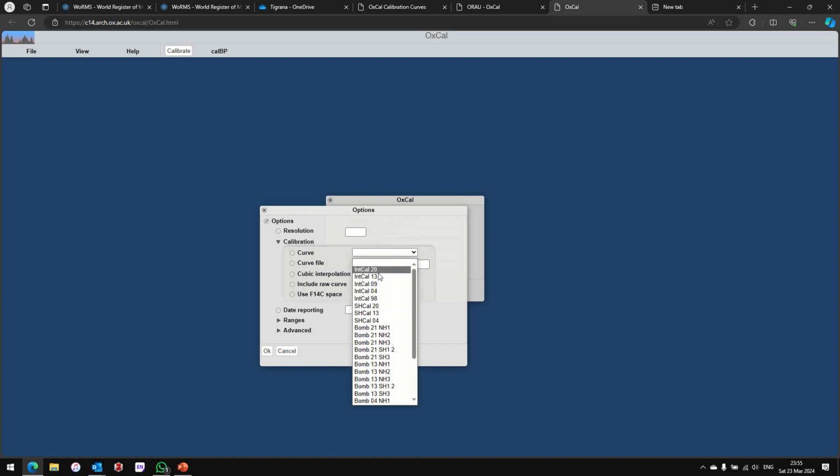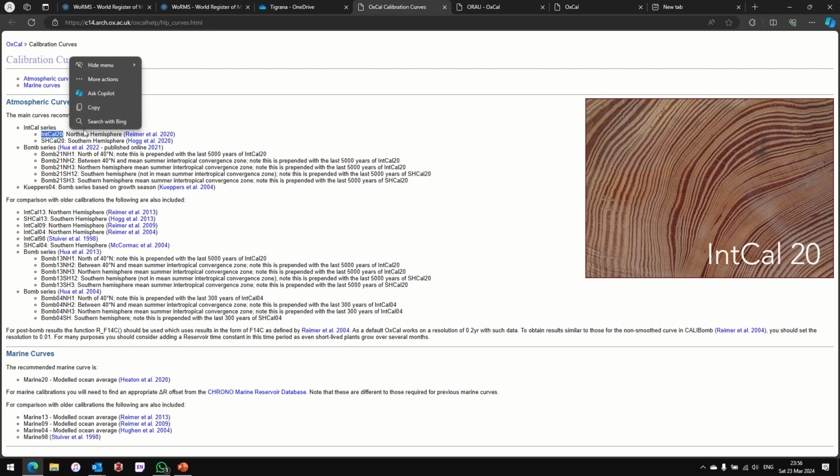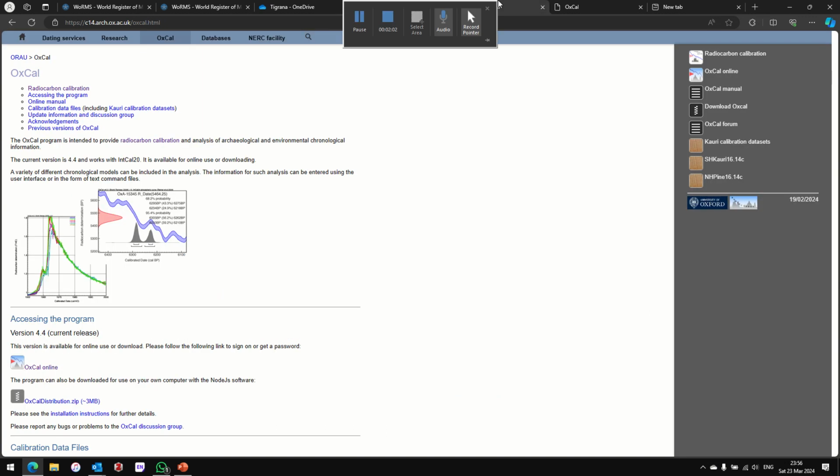mine are terrestrial gastropod samples, and these bomb curves don't seem appropriate for that, because these bomb curves are apparently the hydrogen bomb. I really don't know what these exactly are. The most appropriate curve that seems to me among the atmospheric curves is IntCal20 from the northern hemisphere. And since these are terrestrial gastropod samples, the marine curves do not seem well suited for that.